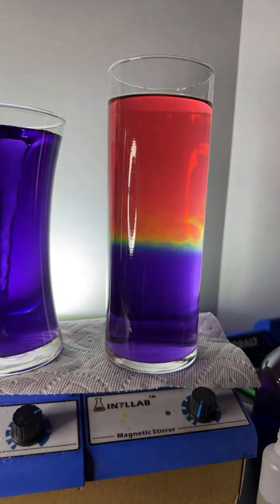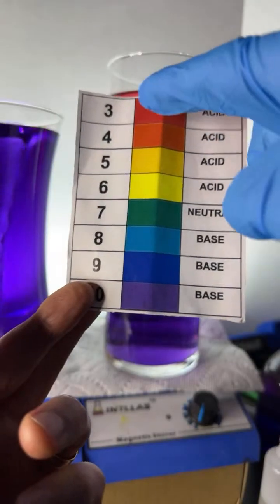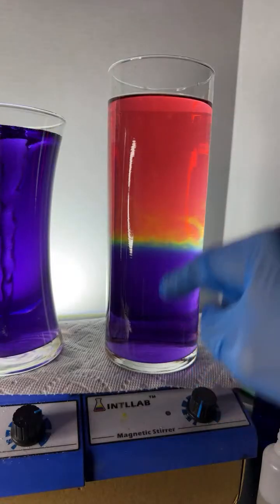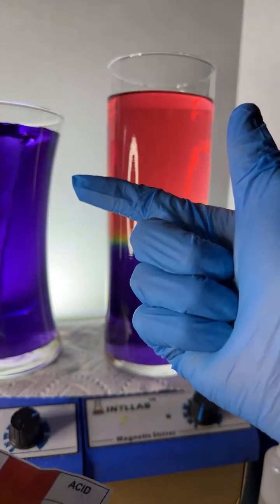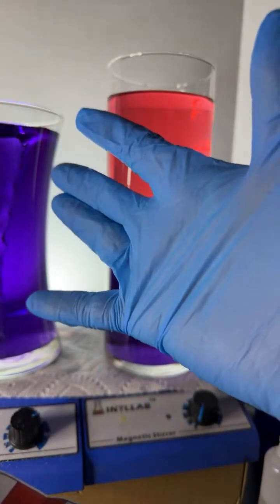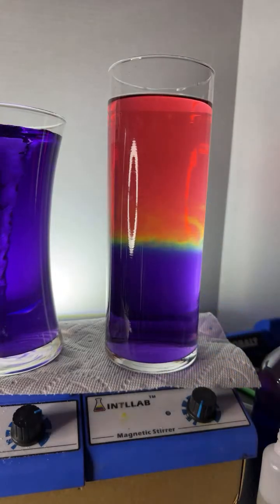Now, because of this, in this very flask, we've got pH 3 up here, and pH 10 down here. Well, that's a difference of 7. So to find the difference of acidity between the top and the bottom, we go 10 times 10, 7 times. 10, 100, 1,000, 10,000, 100,000, a million, 10 million. So the difference in acidity between the top and the bottom of this same flask is 10 million times. Is it safe to drink?